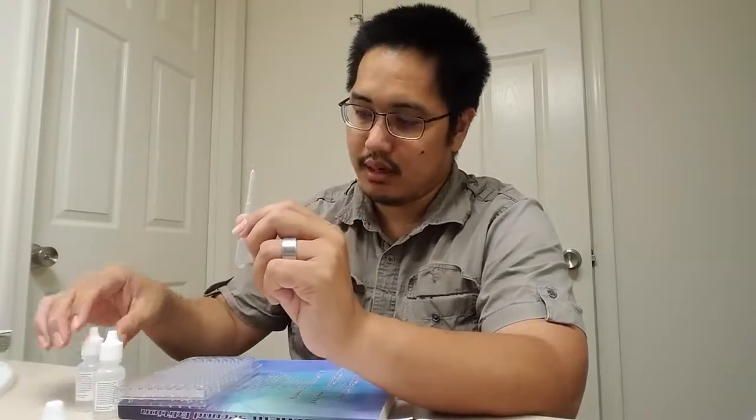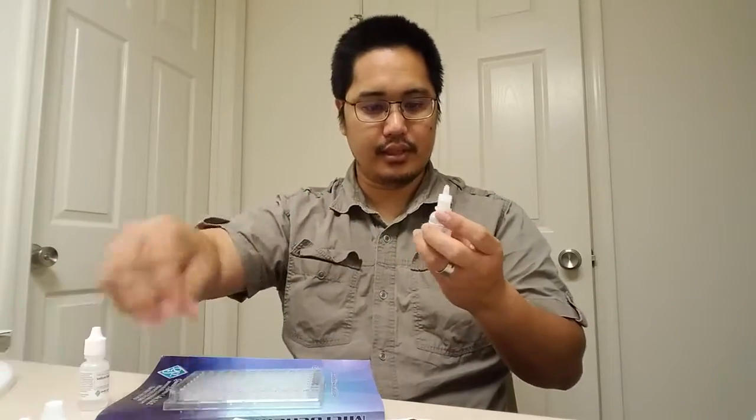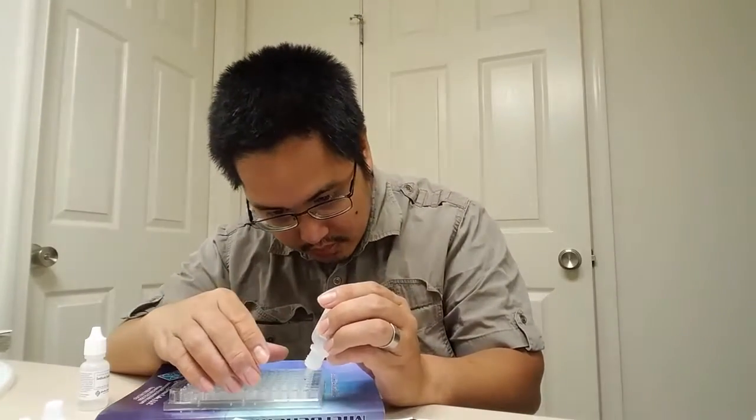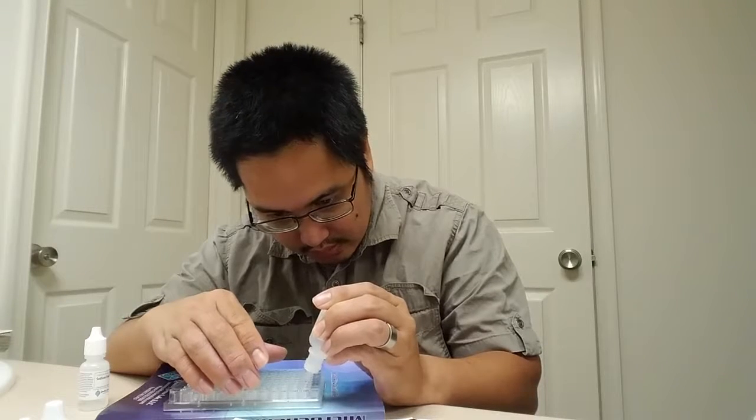So here's how this experiment is done. We're going to assume that one drop from this mini pipette, this little tiny piece right here, is about half of a drop of what this pipette can give. Now, in well A1, you're going to put 5 drops of the calcium nitrate. So that would be 1, 2, 3, 4, 5.